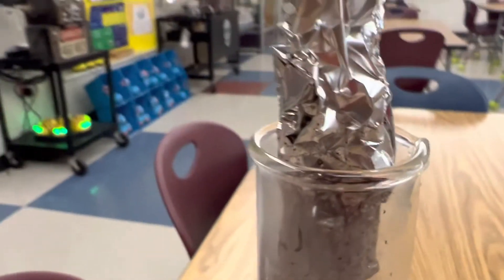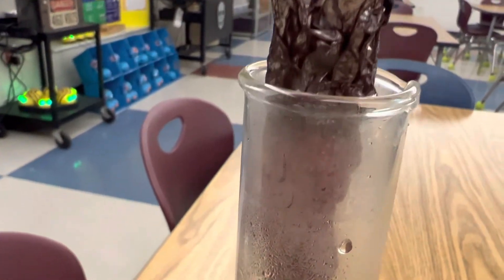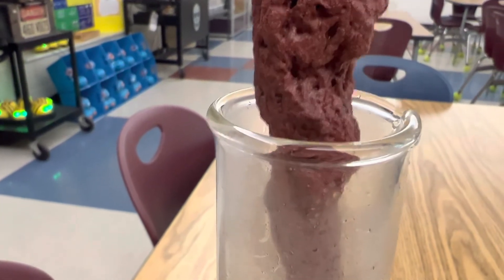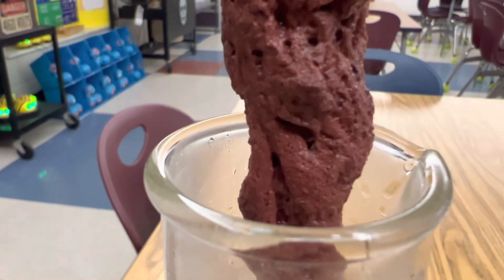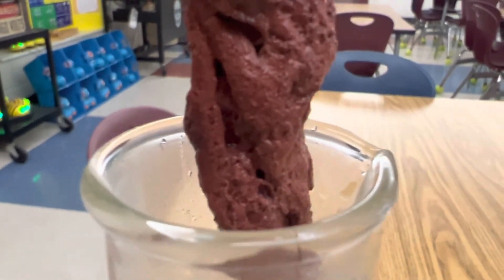And then up here you can really see the difference. Here's the aluminum that we started with, and look how much it's changed in just a few seconds. Unbelievable.